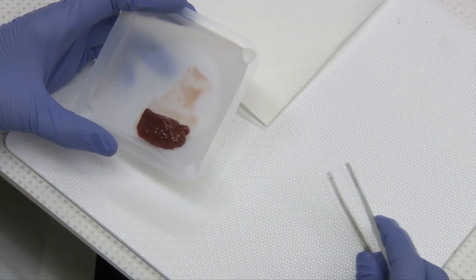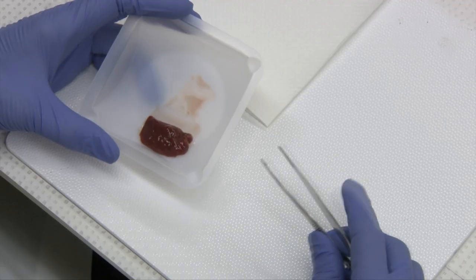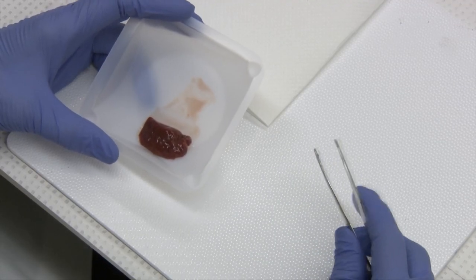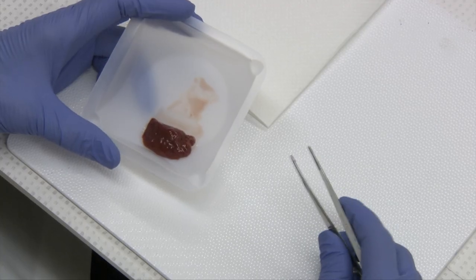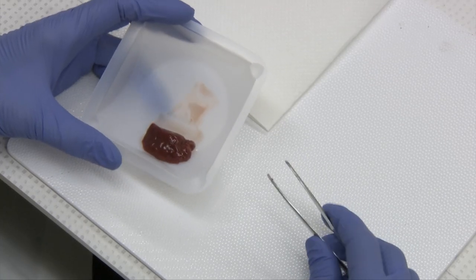The next method we want to show you is making an impression smear. An impression smear can be made from any biopsy or from surgically excised tissue. Here I have a piece of liver tissue.